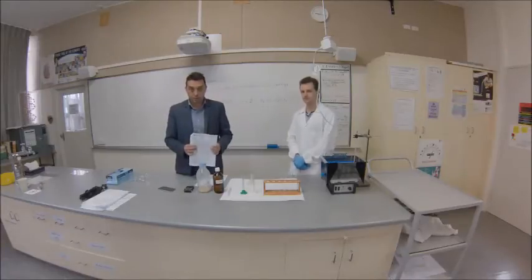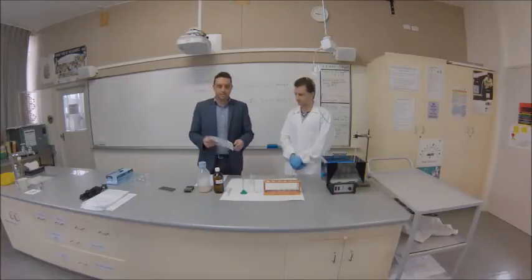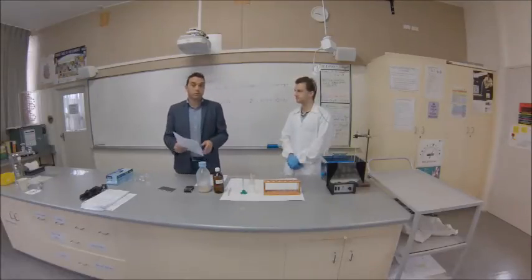You're going to need to use the method we show you to design your own investigation to test the effect of factors that might affect the rate of respiration in yeast. We'll discuss that more in class, but you will be designing your own investigation.